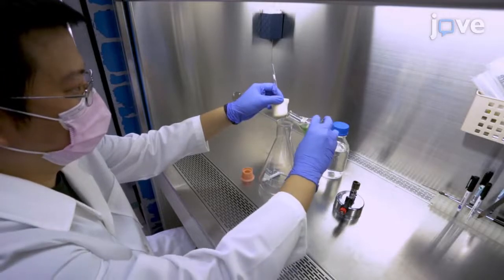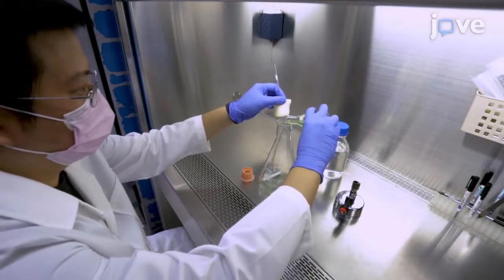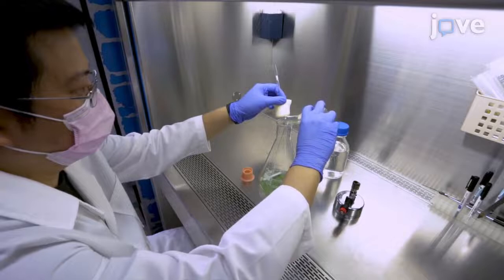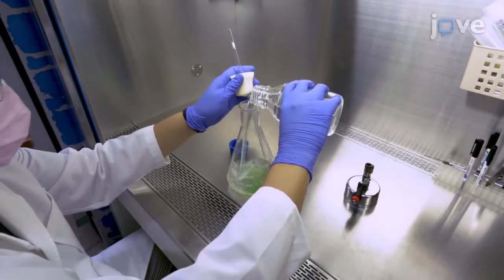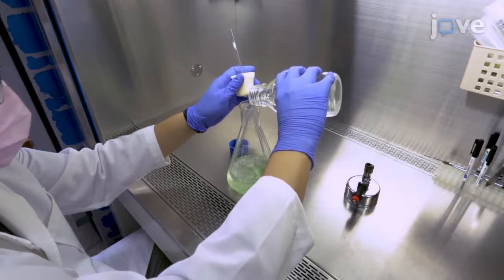Begin by transferring the cell culture of 0.8 OD at 750 nm into a 1.0L flask and dilute it in 500 mL of BG-11 HEPES medium to achieve an OD of 0.2 at 750 nm.